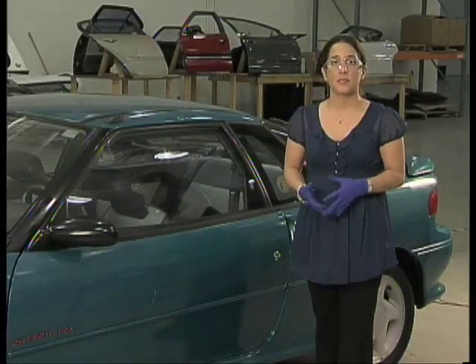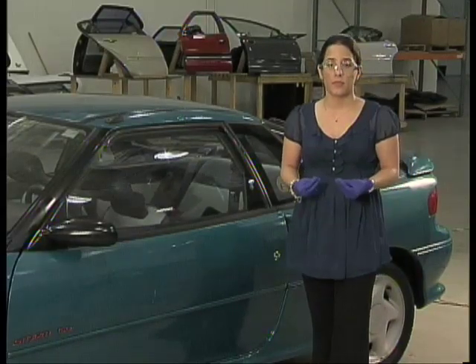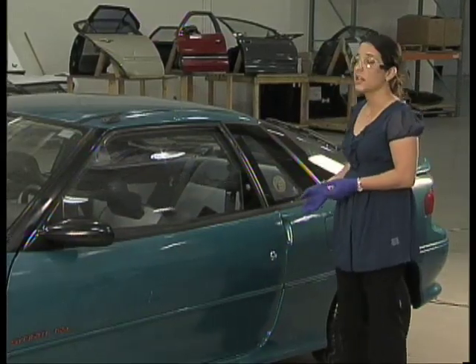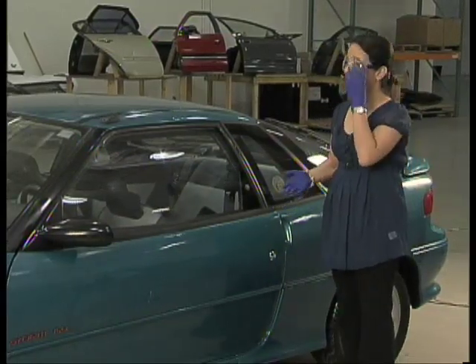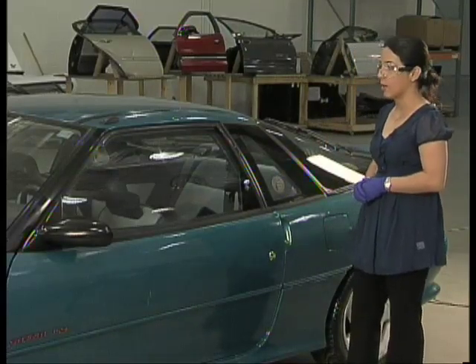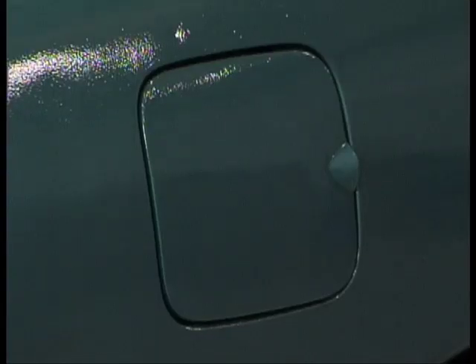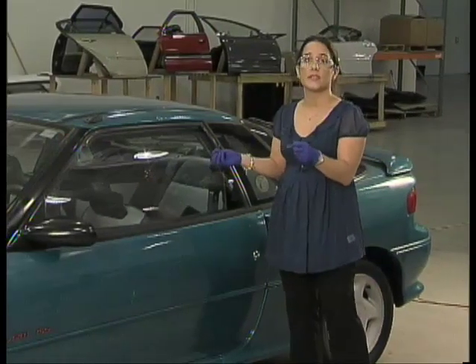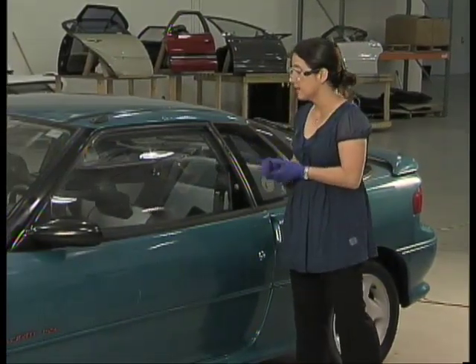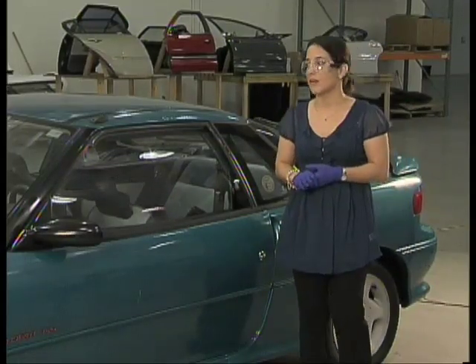For instance, a person who has been packaging drugs for transport may have drug particles on their hands and would transfer them to the vehicle as they step in or drive it. Areas to test for particles include the door handle, the gas cap, and once inside, the steering wheel, the gear shift, and perhaps the mirror used to adjust their view.